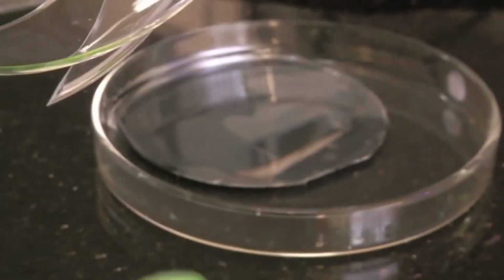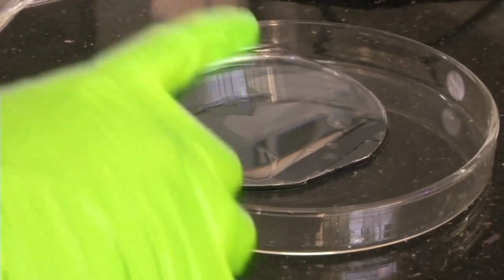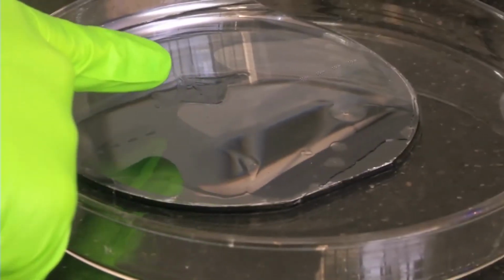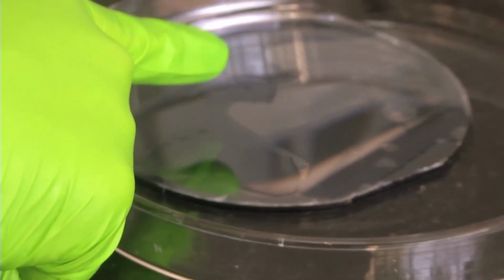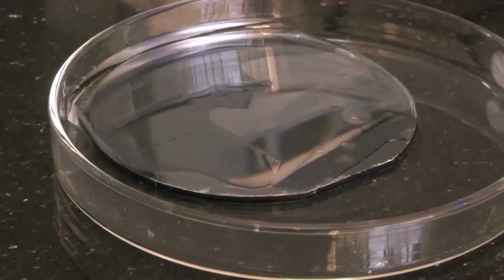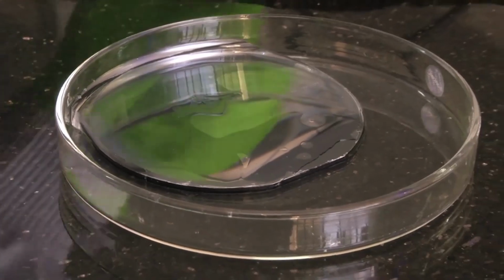Now we have our core area we have to do. We have to peel off the PDMS on the surface of this silicon mold. You see the pattern here. So the pattern is here. So we need to take the PDMS below this pattern. So that's what we are going to do. Let's do the peeling off process.